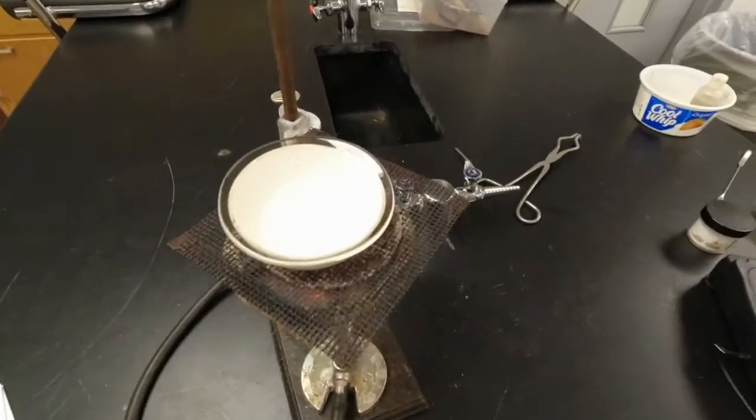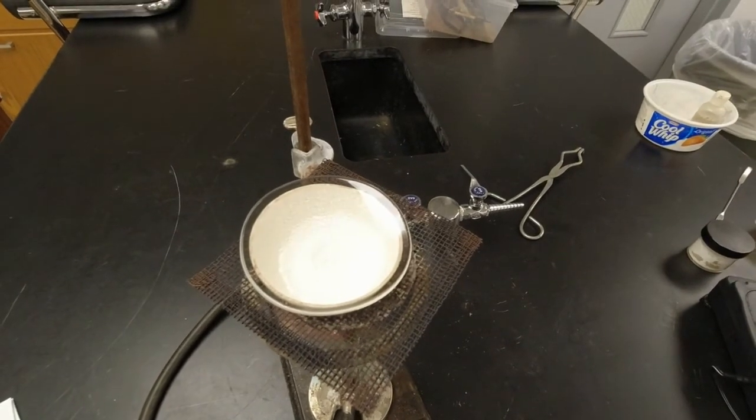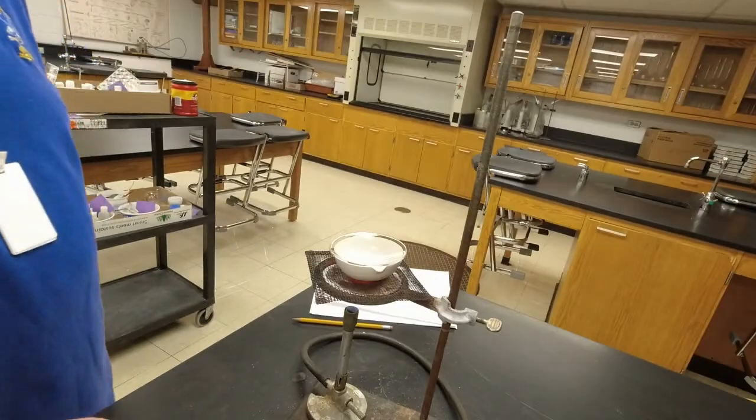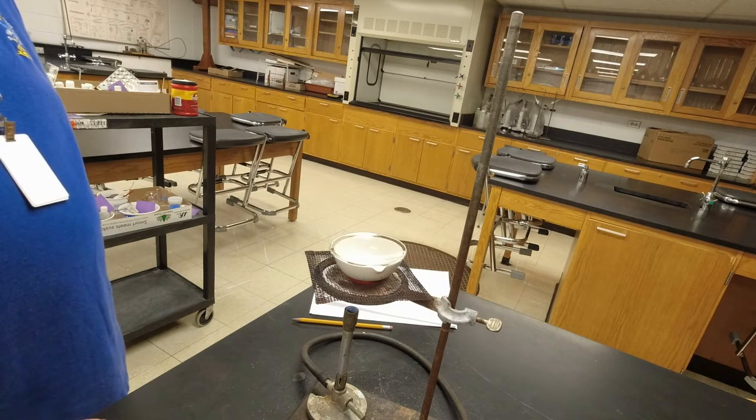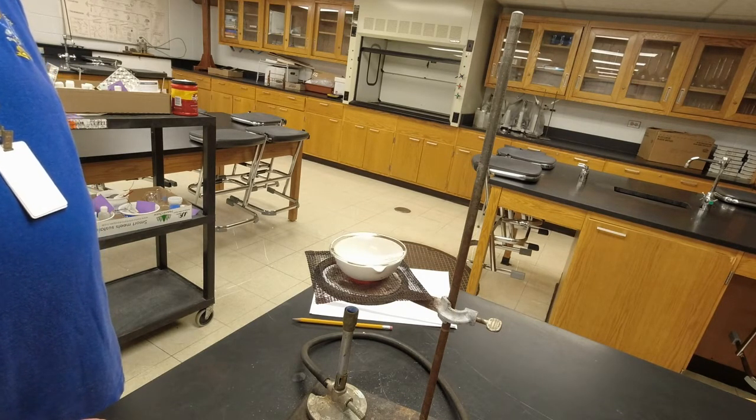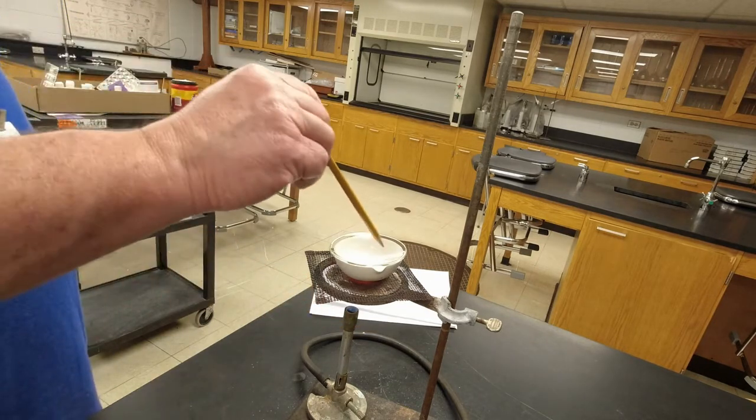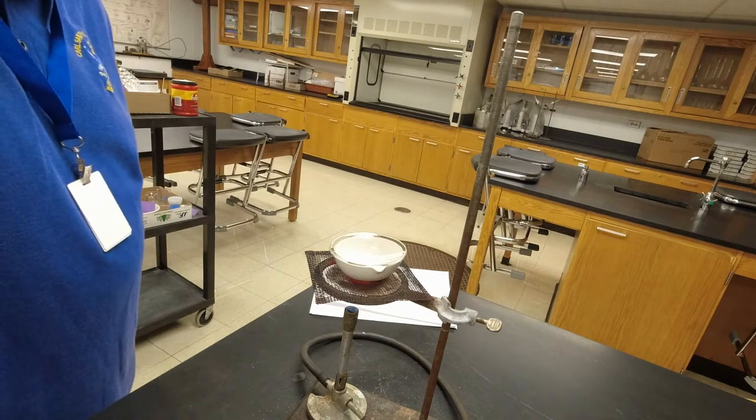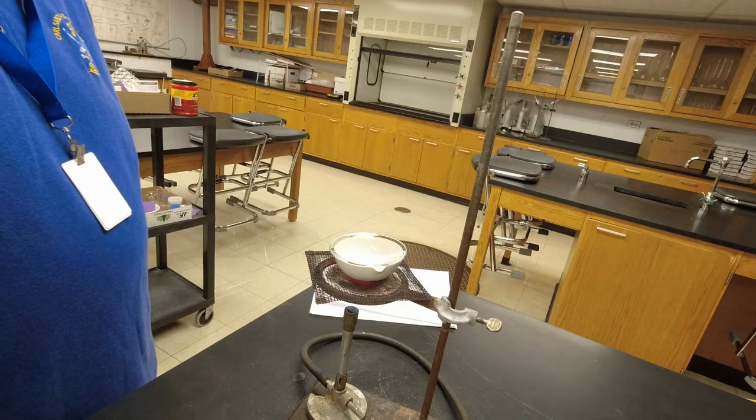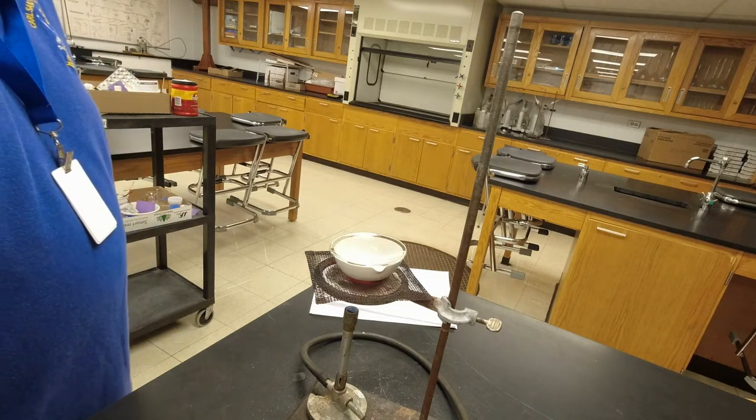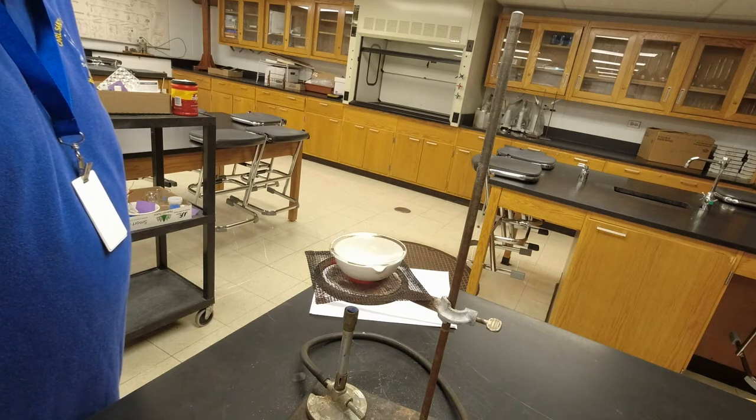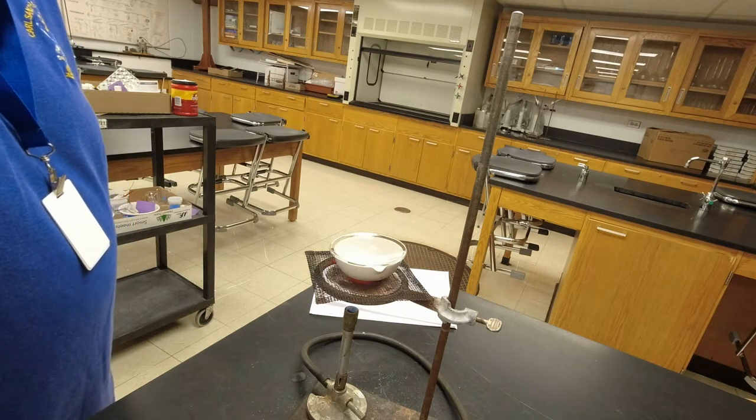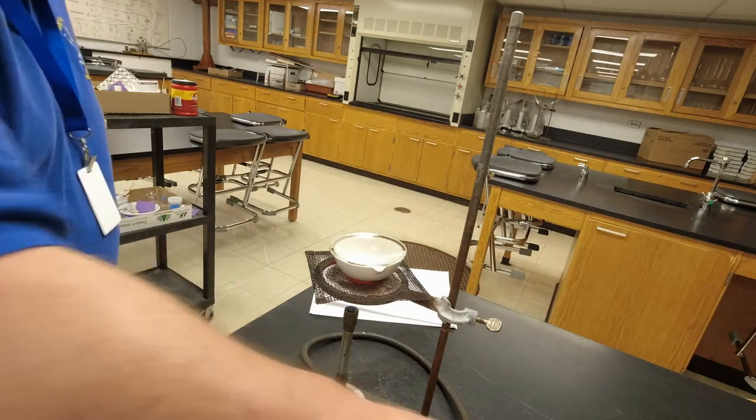I don't know if you guys are getting a glare from the light or not. But I see that there's a lot of little water droplets on there. There's fewer and fewer and fewer. It's not going to take much longer. Almost gone. There's just a few little water droplets underneath on this side over here. When they're gone, we'll be done. And there goes the last little water droplet just evaporated off of there. So now what we need to do is we need to wait until this cools.